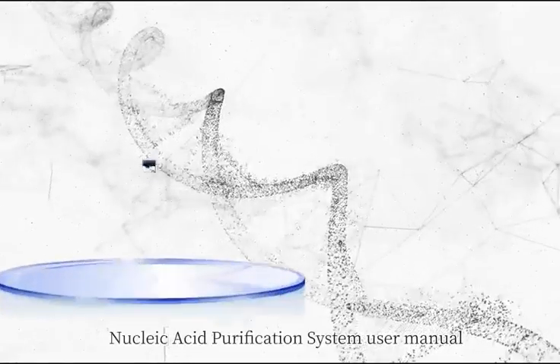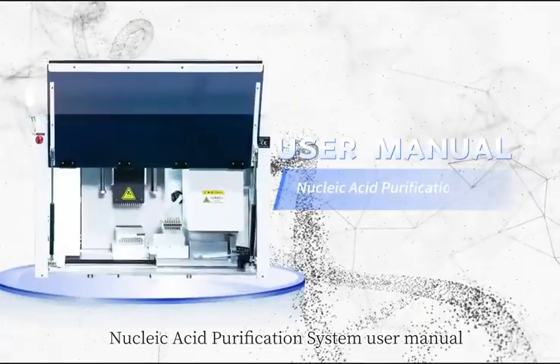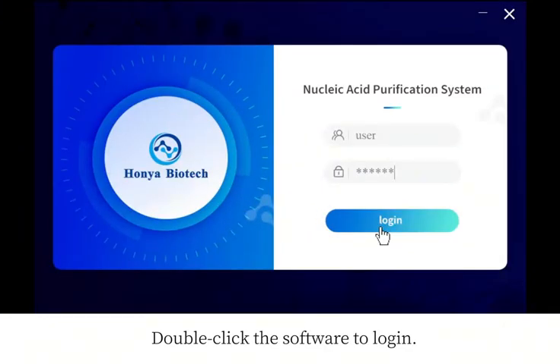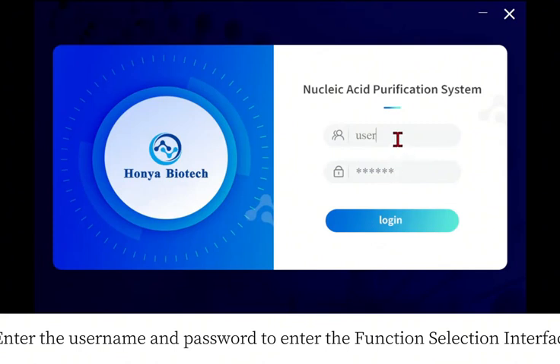Nucleic acid purification system user manual. Double-click the software to log in. Enter the username and password to enter the function selection interface.